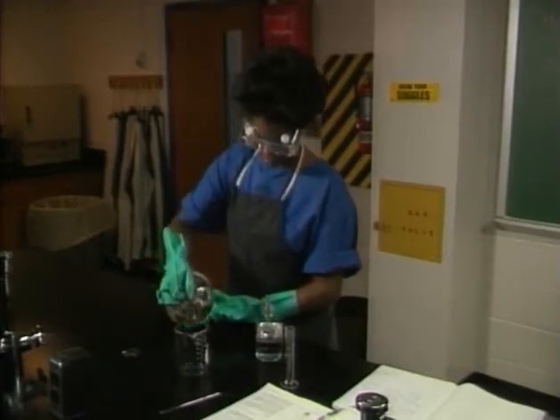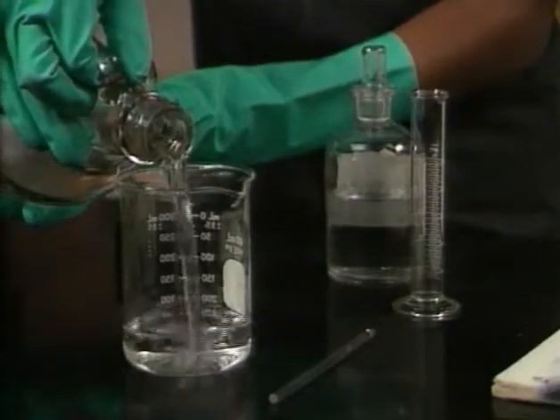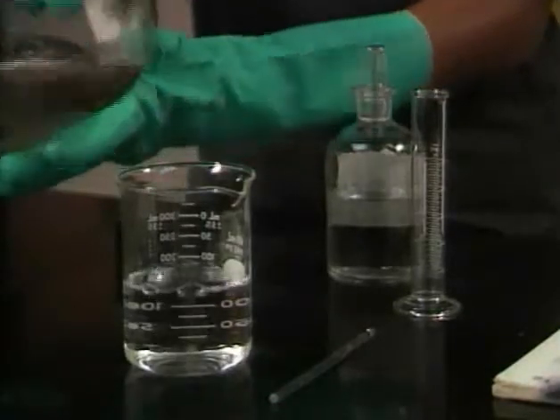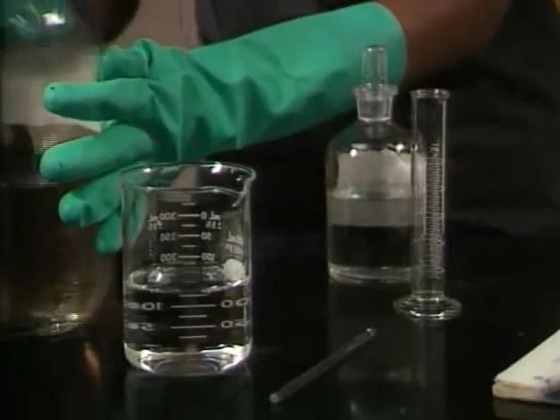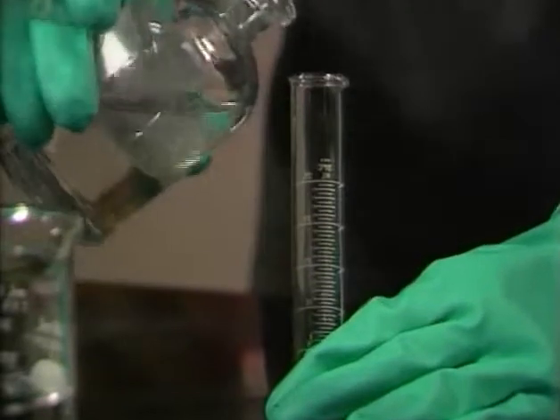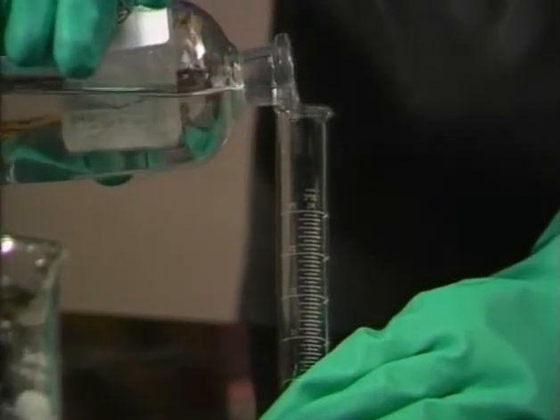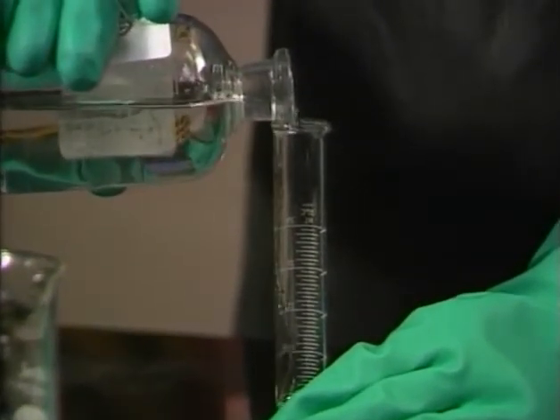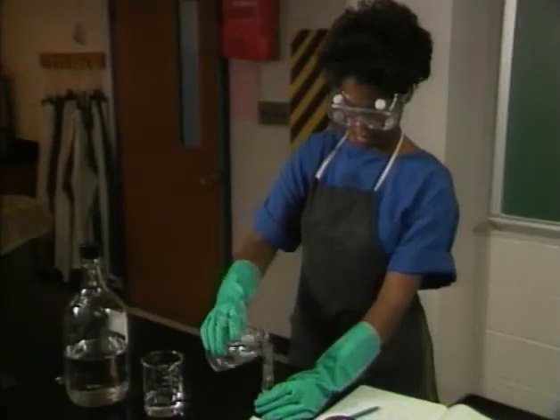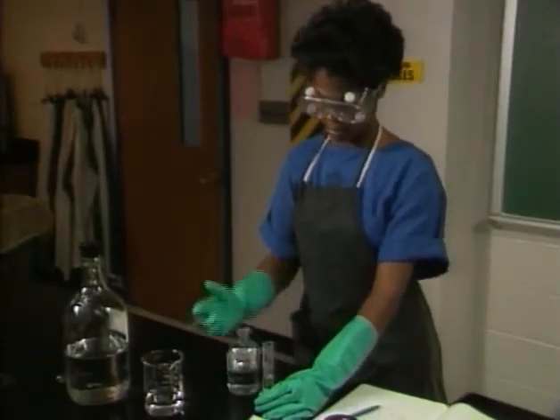For example, suppose you have to dilute concentrated sulfuric acid with water. You might think you could mix them together any way you wish, but there's an important rule for diluting concentrated sulfuric or phosphoric acid that should always be followed: add the acid to the water, never the reverse. Remember it by the initials AA — add acid. Watch what happens when you don't follow this rule.